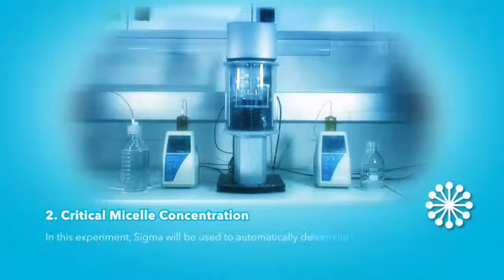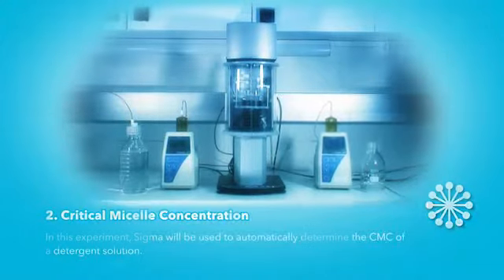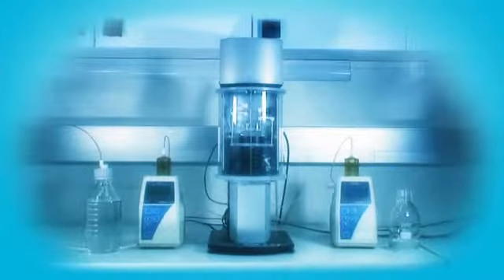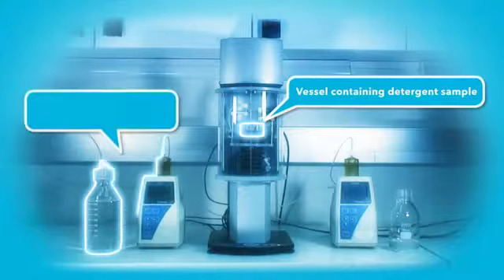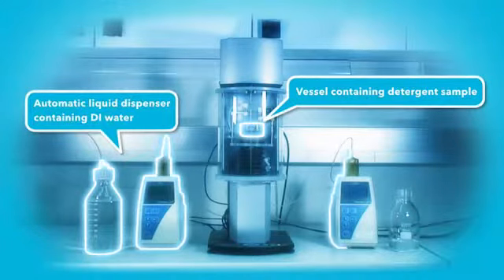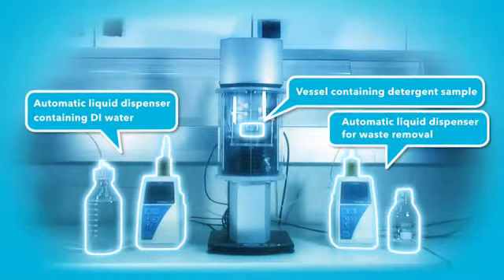In this experiment, Sigma will be used to automatically determine the CMC of a detergent solution. A concentrated surfactant solution is on the sample stage, and two dispensers are connected to Sigma. One dispenser is used to add diluting water, and the other to remove excess liquid.